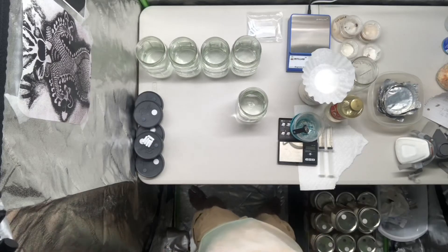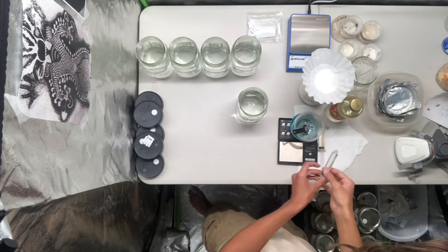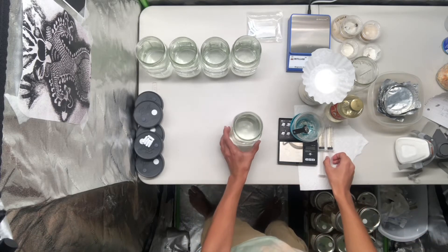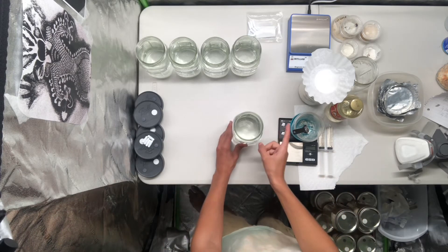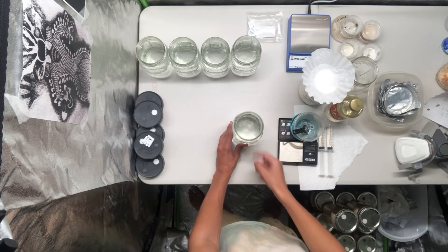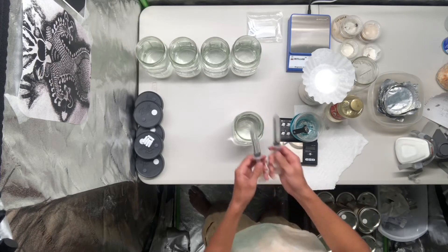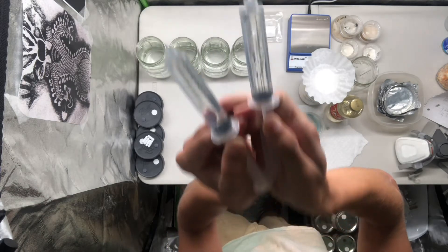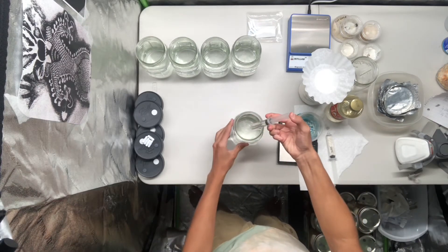I'll start off with the procedure for the Karo liquid culture. Since we're doing a four percent dilution, you'll want to use four milliliters of Karo per 100 milliliters of water, and since we have 700 milliliters of water, four times seven is going to be 28. So we have about 28 milliliters of that corn syrup that we'll add straight into this water.